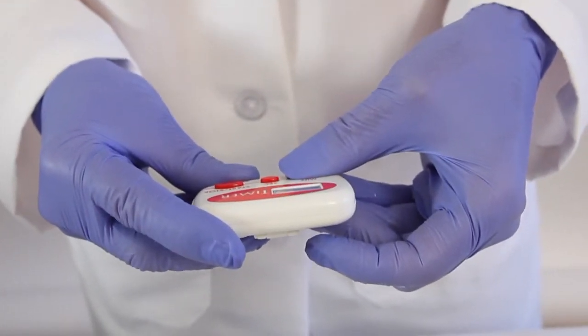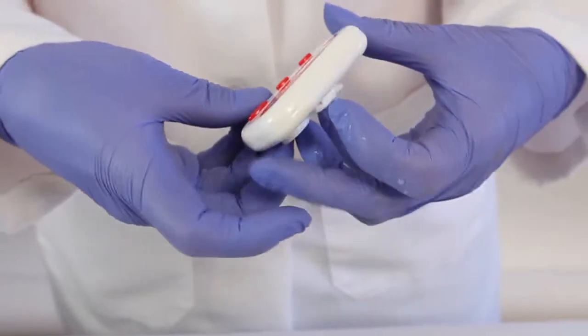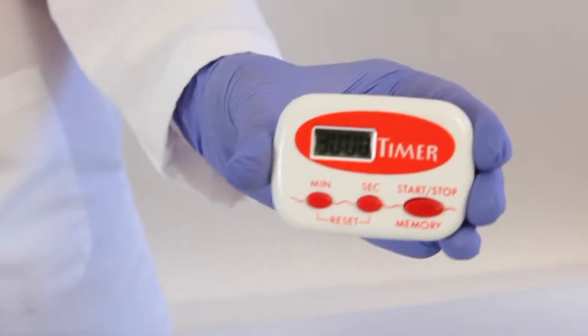I keep a timer with me because I never want to over-decalcify the tissue and ruin it. Remember, there's always a patient behind the tissue.